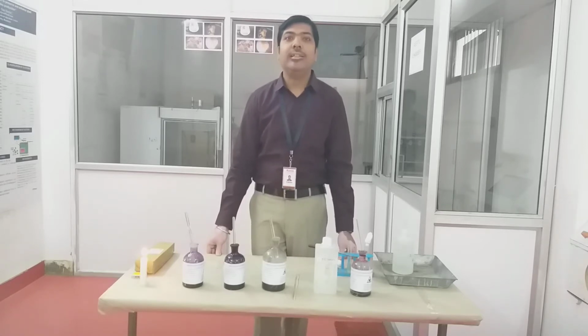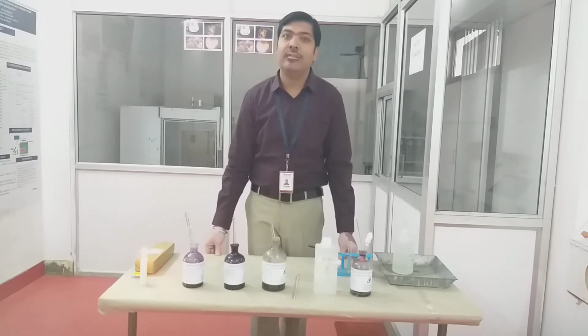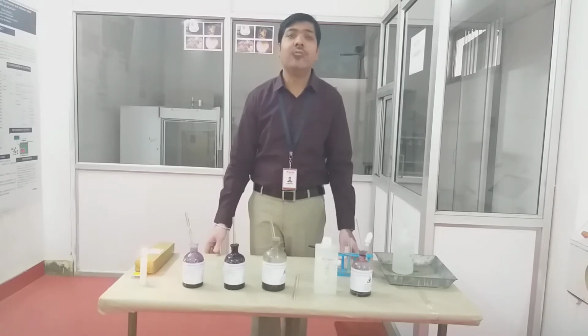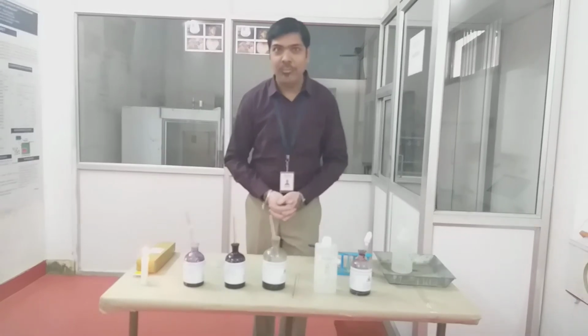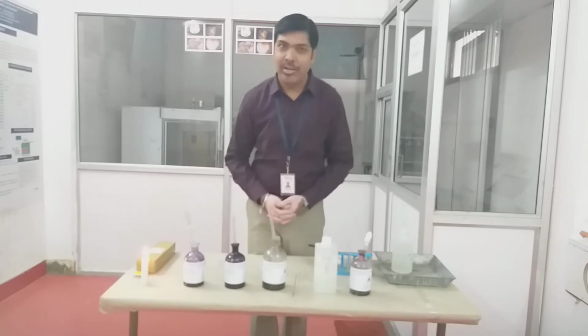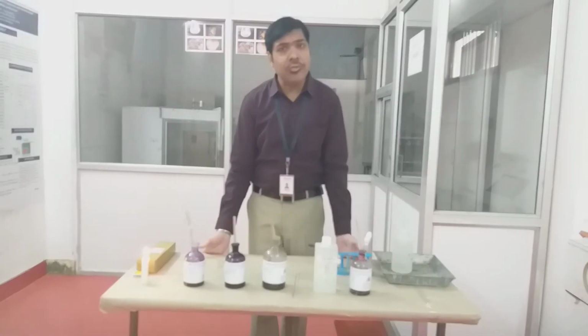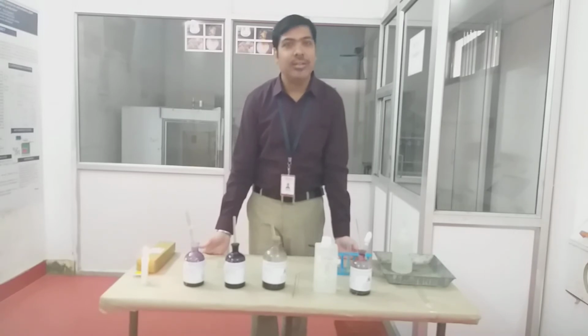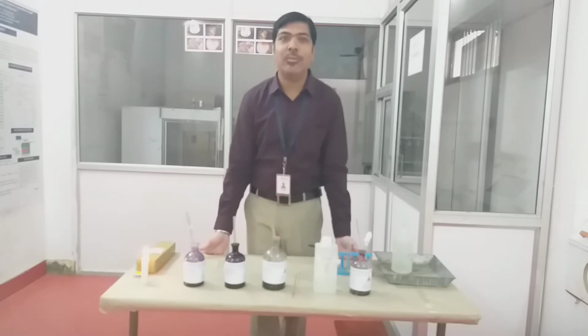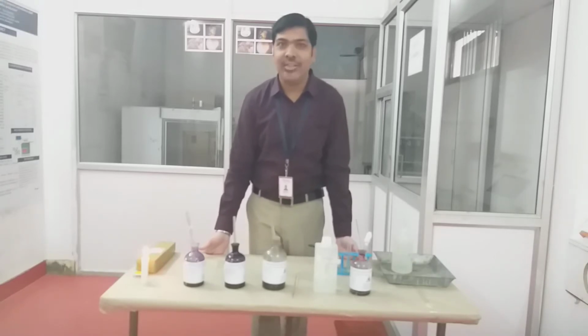We also know that these staining methods have different categories. The simple staining method is available, the gram staining method is available, the differential staining method is available, or the acid fast staining method is also available. So different methods of staining are available. As per our curriculum, we need to perform the simple staining and gram staining methods. One by one, I will demonstrate how we can perform the simple staining procedure and gram staining procedure in our laboratory. While performing the experiment, I will also explain the exact principle that lies behind that particular staining method.